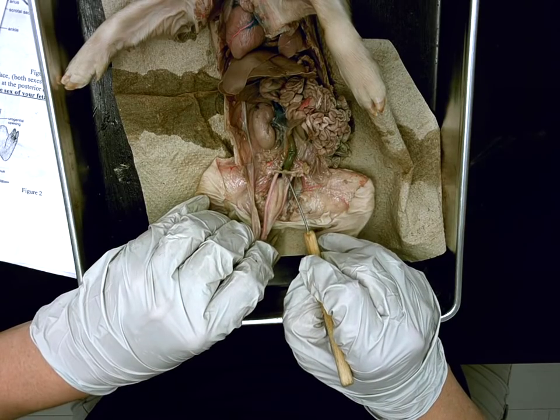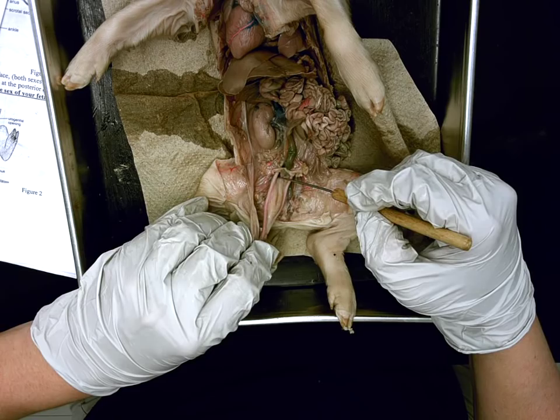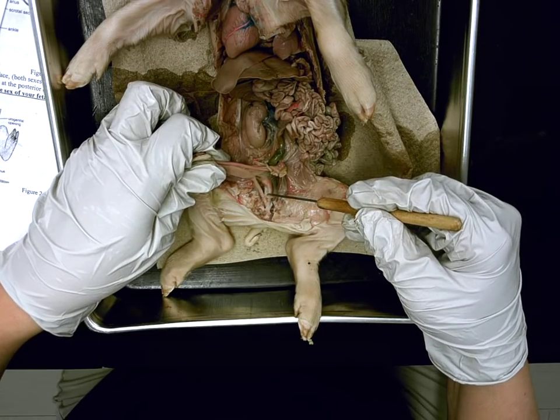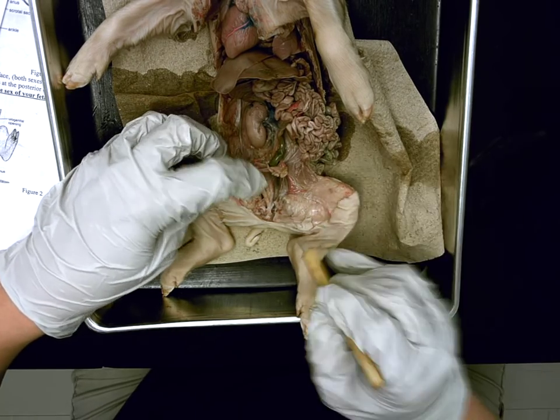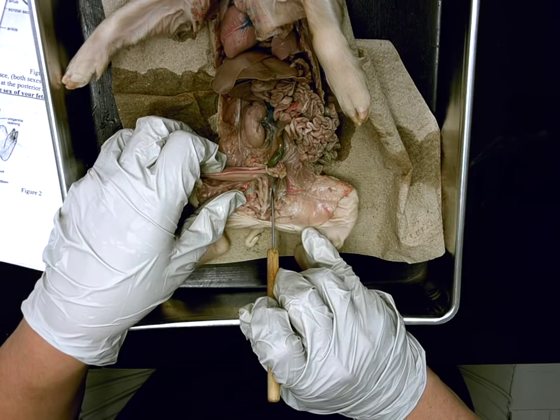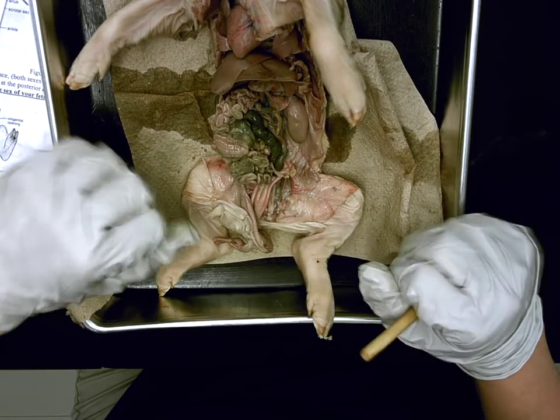Then it unites right here in the middle, underneath the bladder. This tube where they unite — Allison? The uterus. Function of the uterus? Where the fetus develops. Excellent. If we then go down from the uterus, it's now the second tube underneath the urethra — Alexis? The vagina. Vagina function? Site of copulation. Excellent. So copulatory organ where sperm is going to be released. Then there's a tube underneath which is greenish in color — Rachel? The rectum. Function of the rectum? Reabsorbs water and stores feces. Excellent.